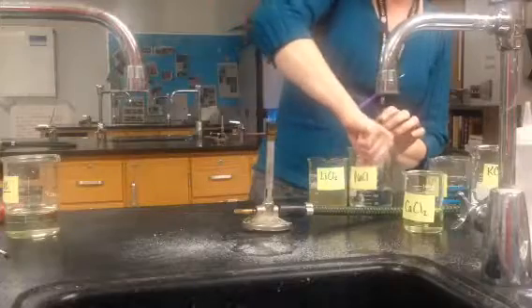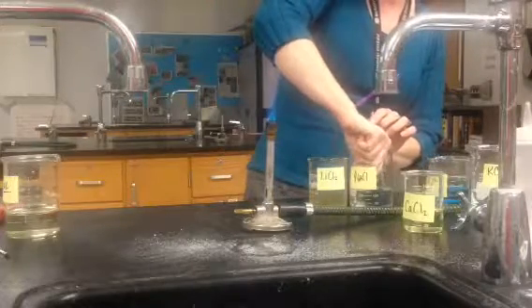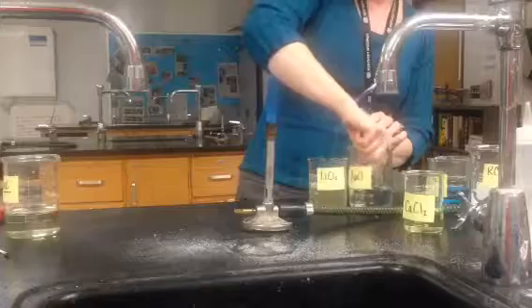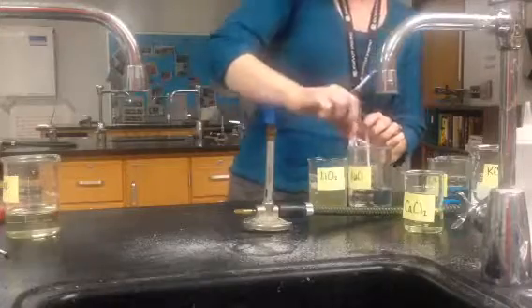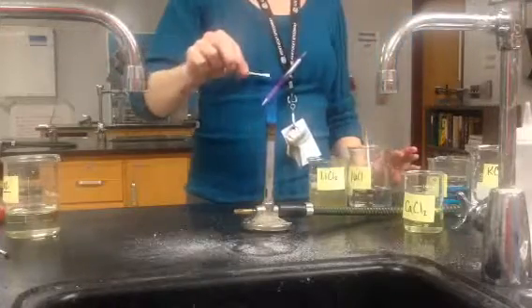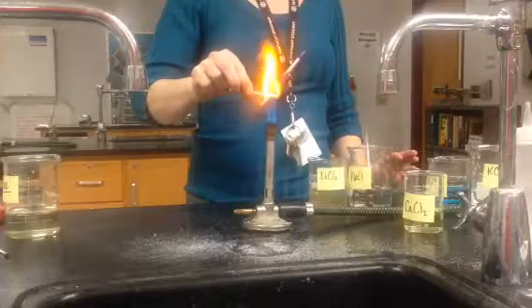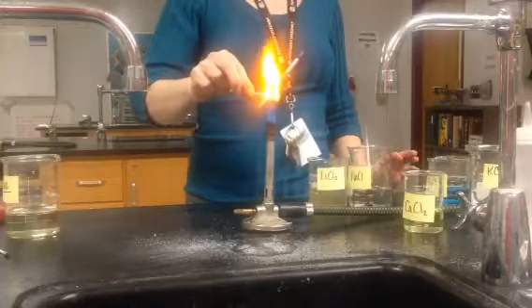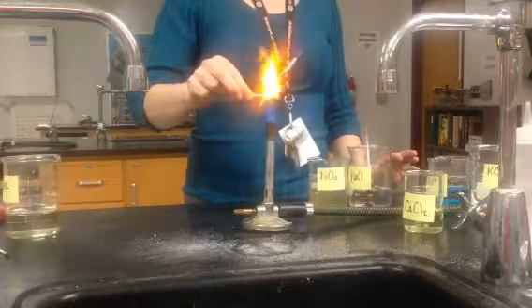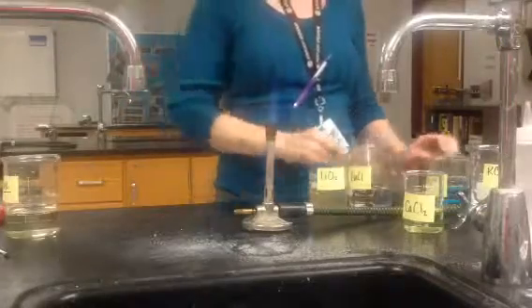We have sodium chloride, which is your table salt — this is pure, it does not have any impurities like what would come in your actual table salt you use at dinner. It's an orange yellow. Not quite — not quite our unknown.